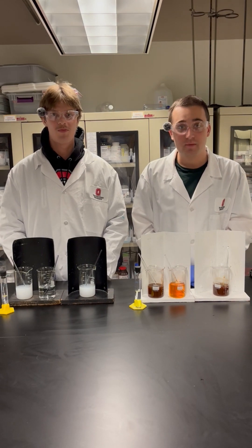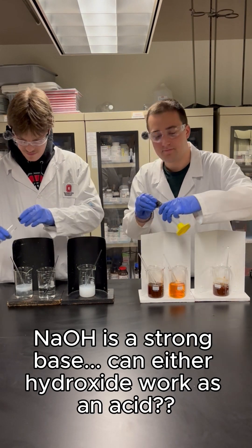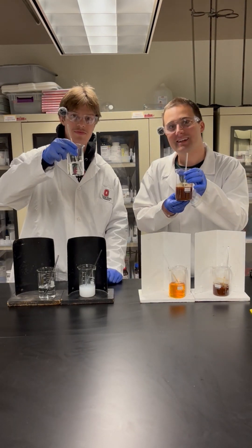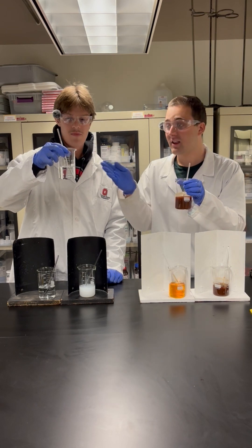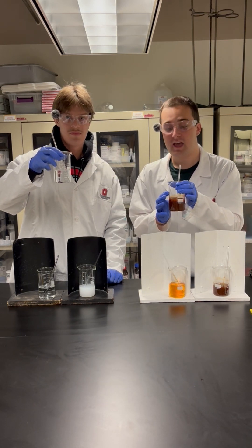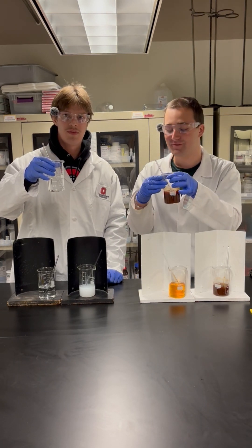Lastly, we're going to add sodium hydroxide to these two beakers and see what happens. As you can see, sodium hydroxide is a very strong base, and the aluminum hydroxide was able to act as an acid and react with it to dissolve. However, our ferric hydroxide could not act as an acid, and therefore our precipitates did not dissolve.